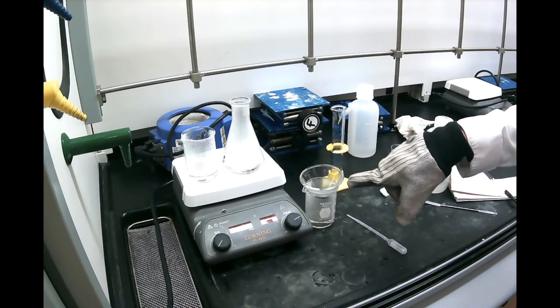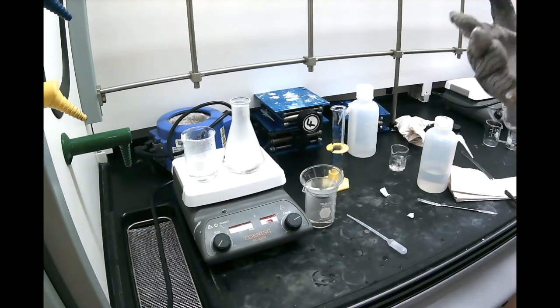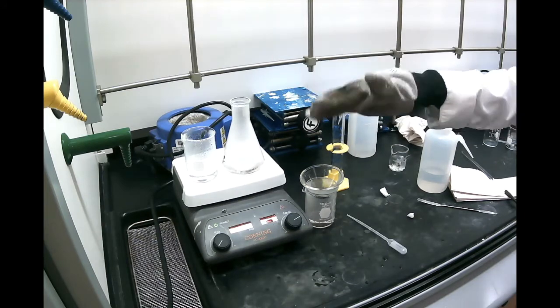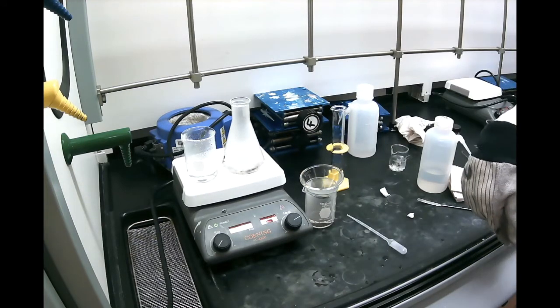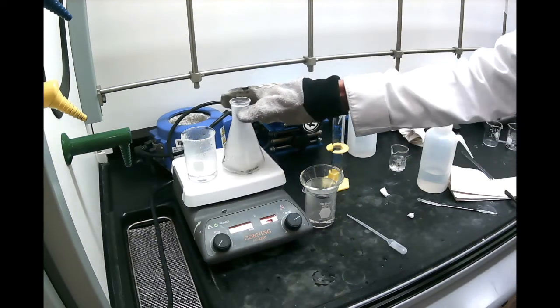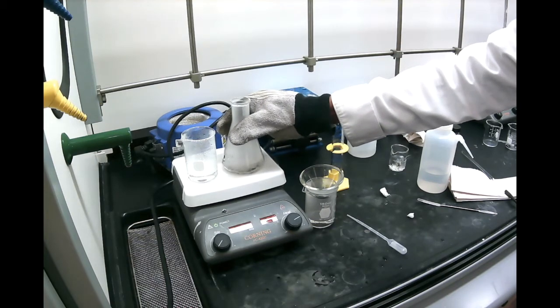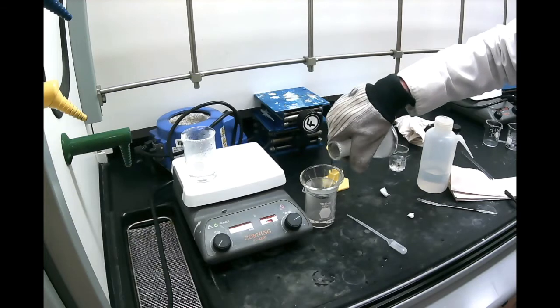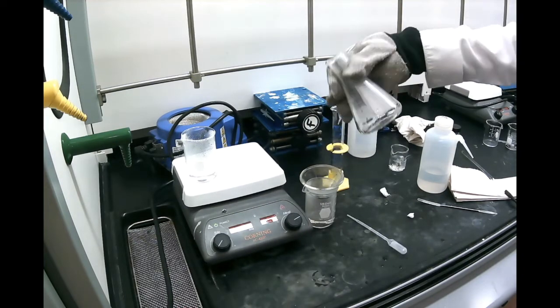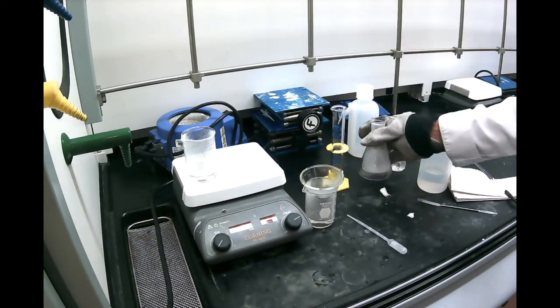The amount that I'm pouring here is less than an inch above the cotton plug. If you put too much on that funnel, you will have bad results because a lot of your crystals will crystallize on the top. So far we've been pretty lucky. It worked pretty well. We didn't have any clogging there. And here's my last rinse right there. Of course you're going to have some residue, but it looks pretty good overall.